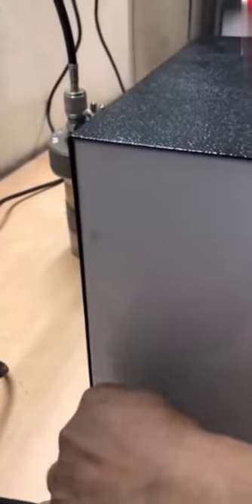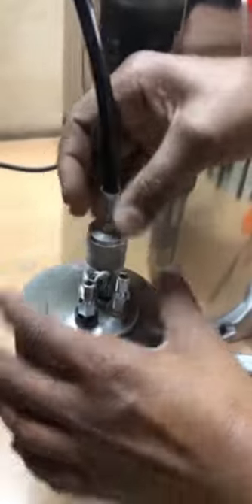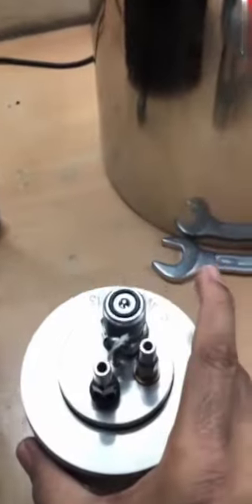To take out the bomb, first we have to release the pressure from the outside port — slightly unscrew, only one or two threads. Notice the sound — so whatever pressure is there inside this tube is released. Now we have to tighten this again so that next time when we fill, oxygen will not leak from this point. Now you will see that this pressure has become zero — now you can easily open it by hand. If you do not release this pressure in the tube, it is very difficult to open. Now in this bomb, oxygen is filled, sample is there, ignition wire and everything is there.